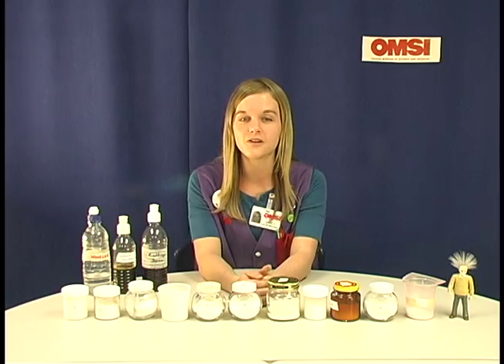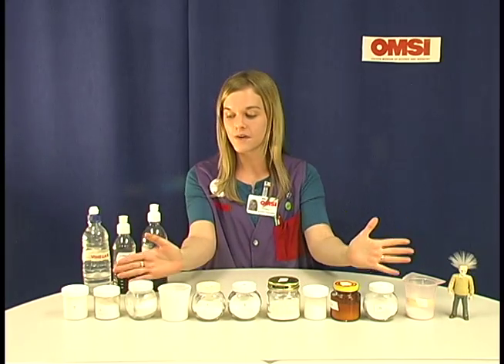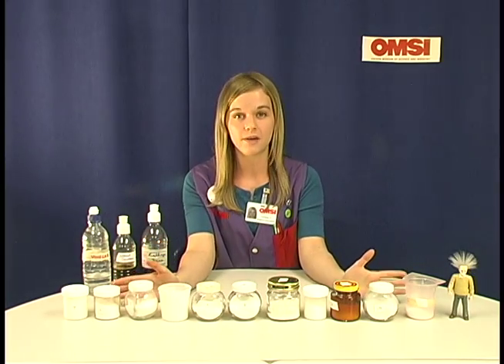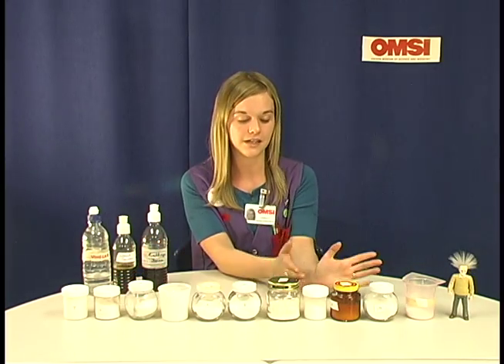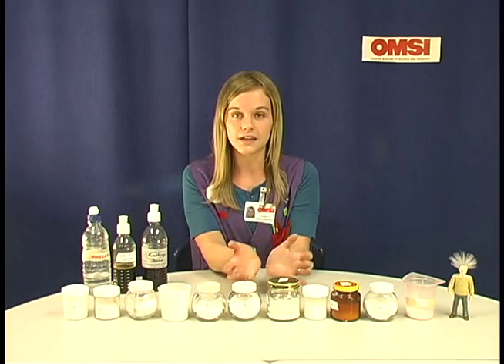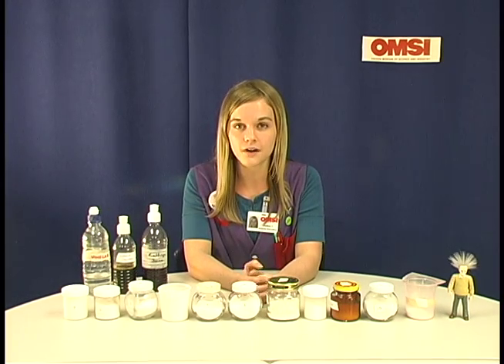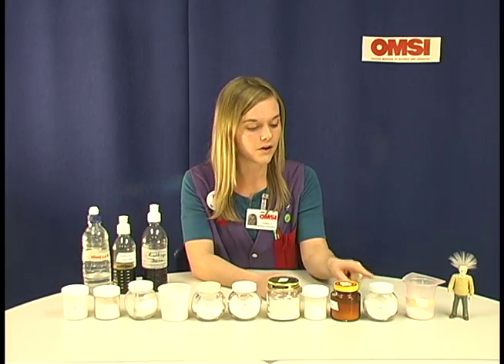Hi, I'm Lindsay and I work at OMSI and I'm here to present the experiment Lost Labels. Here we have an array of unknown powders in miscellaneous jars and the idea is for your students to try and figure out what are all these mysterious white powders.